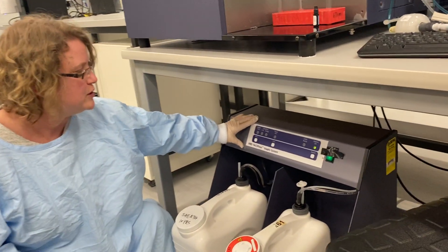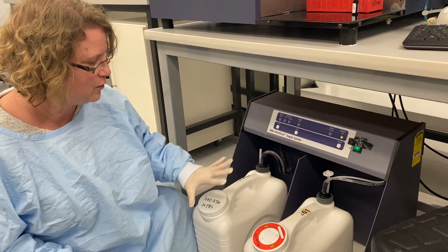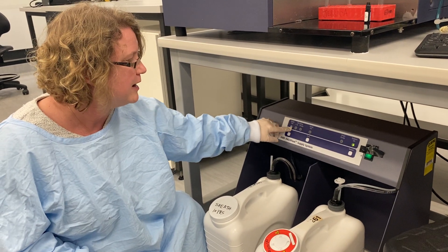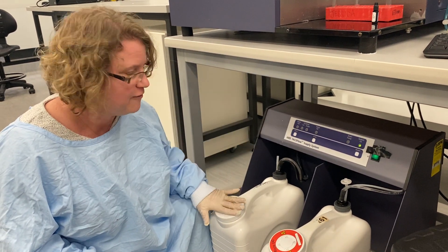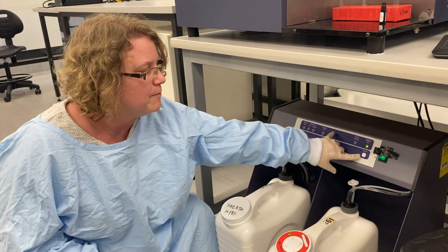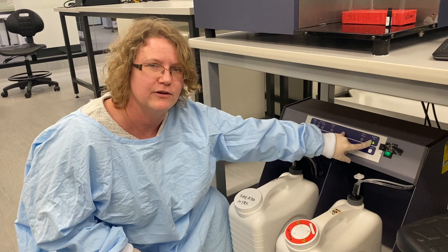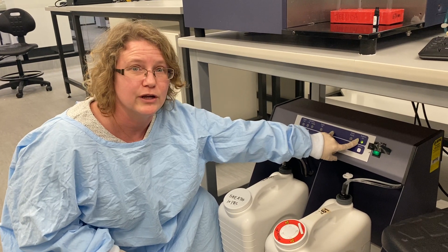The cart is very important. If the waste is full or the sheath is empty, there will be an alarm going off here — one of these will be red. Have a look and see what's wrong, fix the problem, and then press restart. This restart button is very important. If the system is not on and shining green here, the instrument is not working.